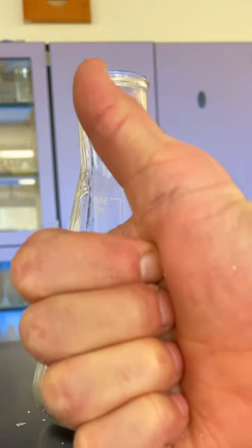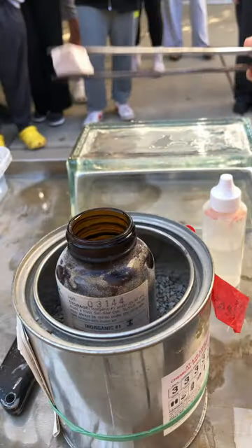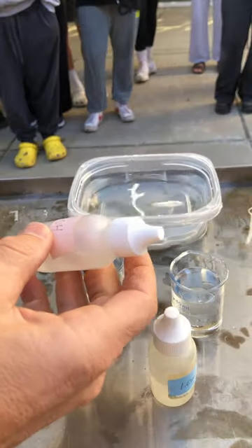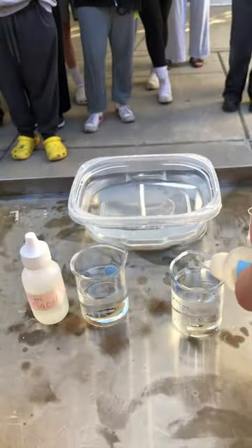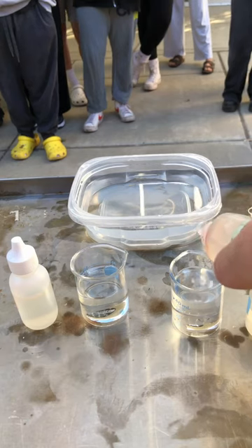Why does that happen? This is sodium — it's really reactive. Let's cut off a piece, and we want to do this somewhat rapidly. This is sodium hydroxide — sodium hydroxide is a base. I put a few drops in. This one is hydrochloric acid. Hydrochloric acid in. Phenolphthalein here — it just tells us about acids and bases.